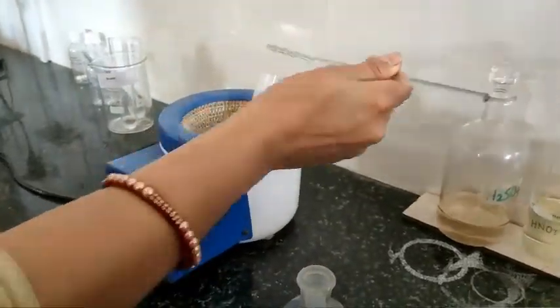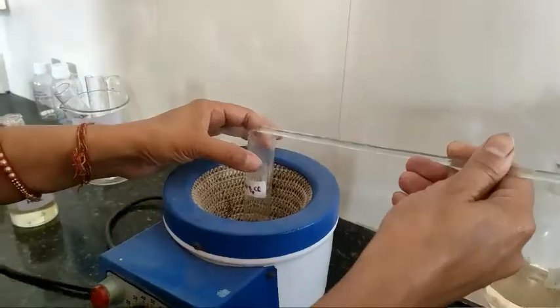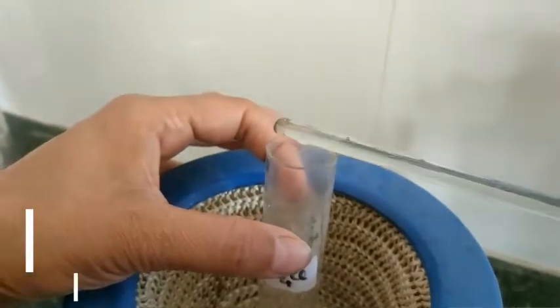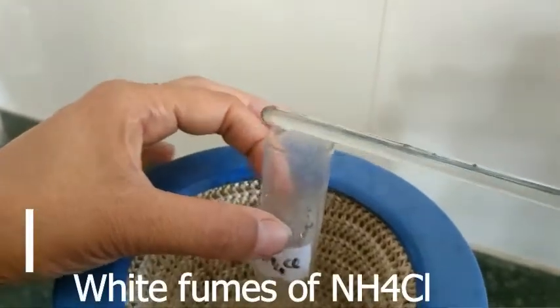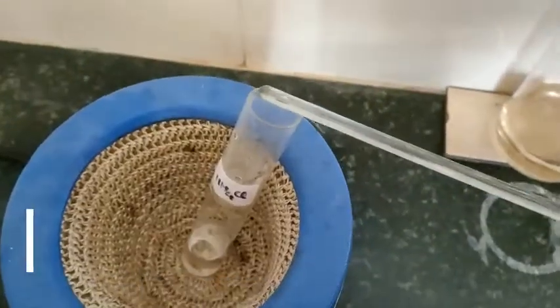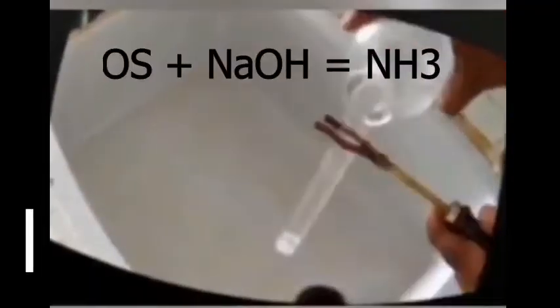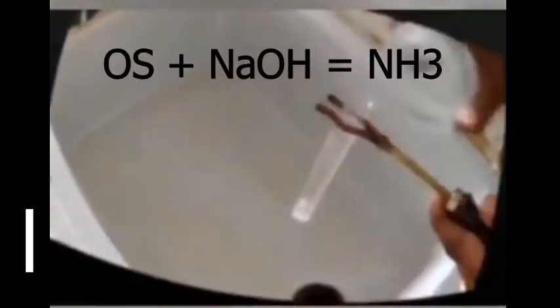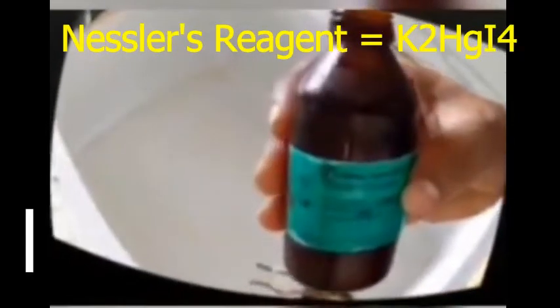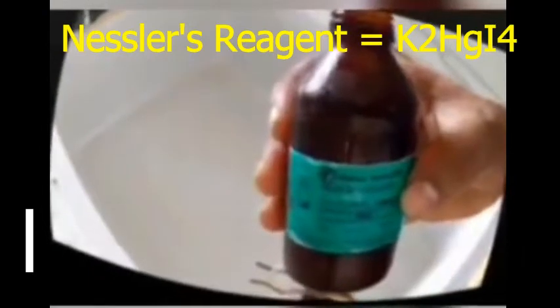To this test tube mouth, I bring the glass rod which is dipped in concentrated HCl. You can see the white fumes of ammonium chloride. For the second confirmatory test for ammonia, I have taken the original solution and added NaOH solution and then Nessler's reagent.